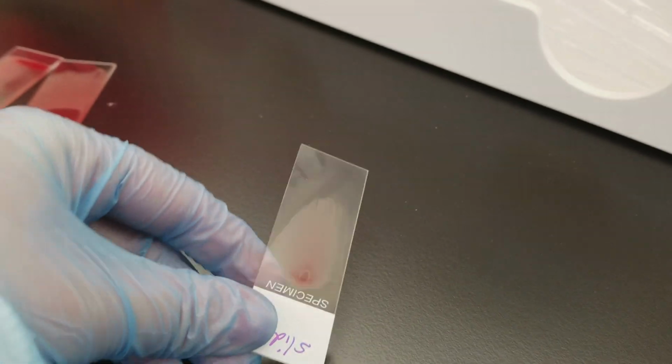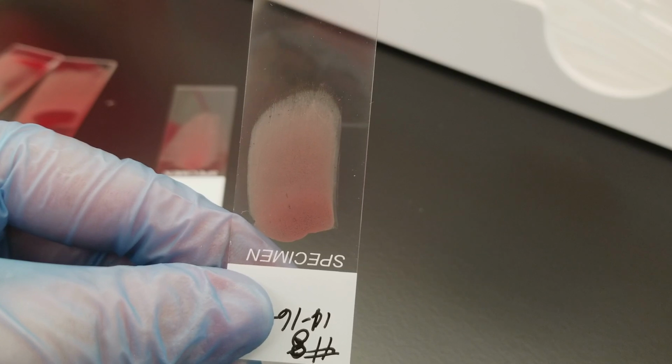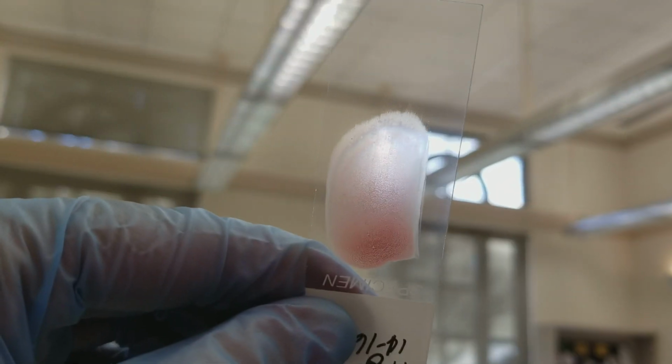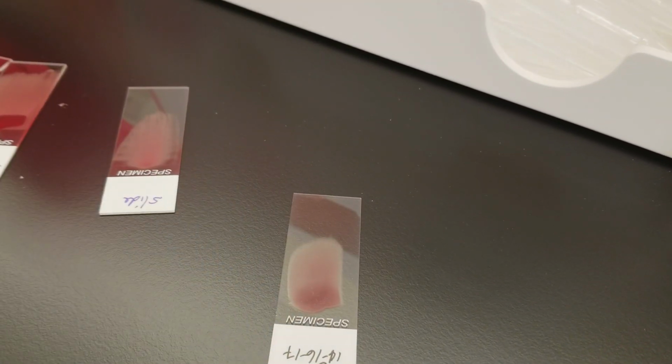I guess you can kind of see it like that. And that would show you when there's a good slide. This one's a pretty good one. It's rather thick, but you can see how there is thinning out on the feathered edge up here. And if I can get the sheen to work, that'd be great. See, you have a sheen that's around it. That shows a good slide right there. So it's where the thick meets the thinner area. And that's basically where you're going to be performing most of your counts. So you want to go to where the red cells aren't on top of each other.